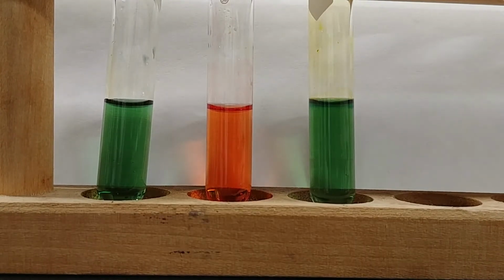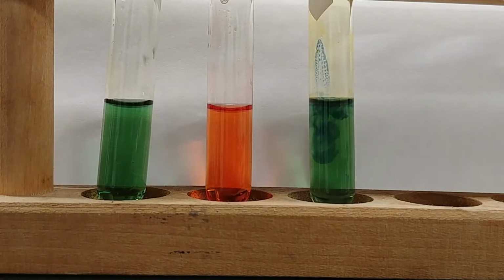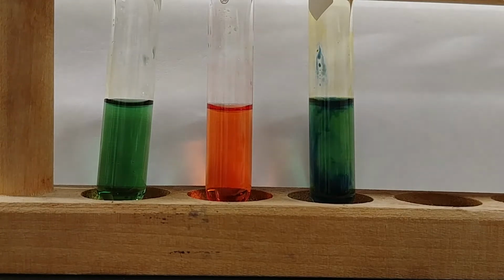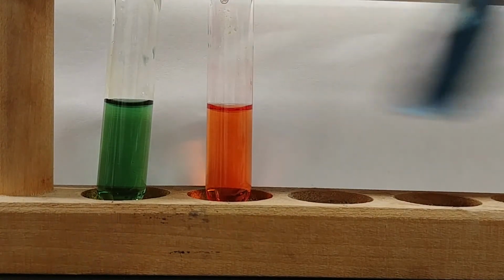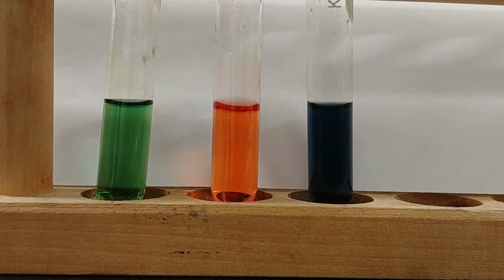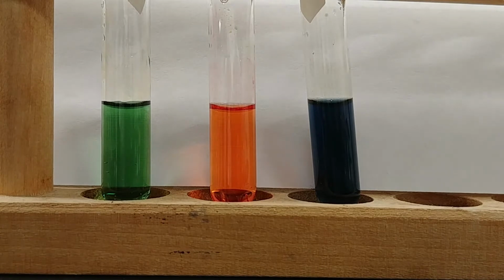In the third test tube on the far right, I'm going to add, again, just 1 drop, but this time of sodium hydroxide. So here we go, 1 single drop. And we see, again, a pretty drastic change. So this is what happens when we add just a single drop of either strong acid or strong base to pure water. Water doesn't seem to resist a change to that pH very well. We can also test these pHs using our pH meter, which we'll show again in post.